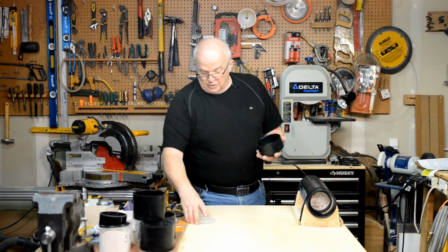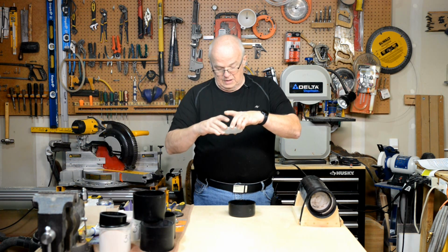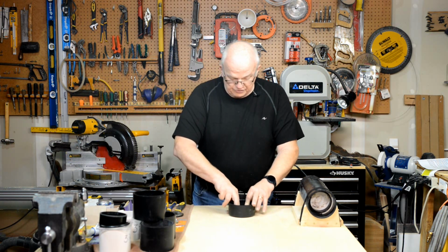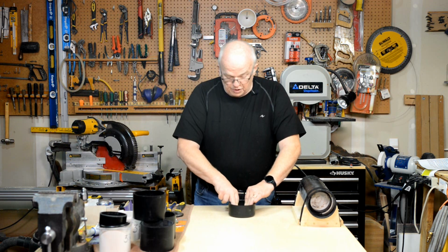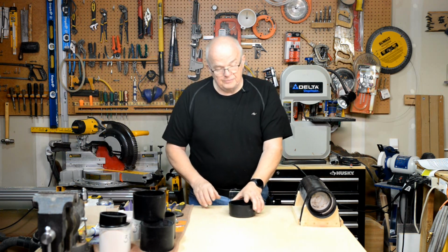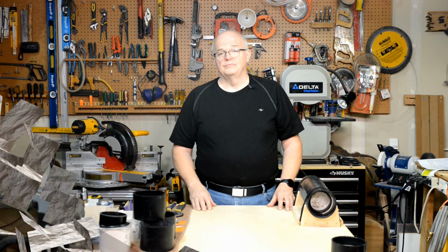What we're going to do is take this and make sure that you've got the beveled edge down. You don't want the beveled edge up. And you want to drop that into there so that it comes in contact with that epoxy. Now you'll notice that it'll turn back and forth really, really easy, which means you're setting it down in there. So press it, set it down in there. Set it aside and leave it alone. Pause the video, then get up to that point and come on back.